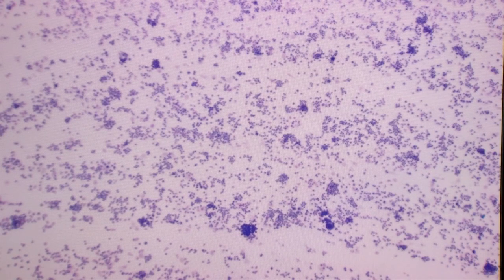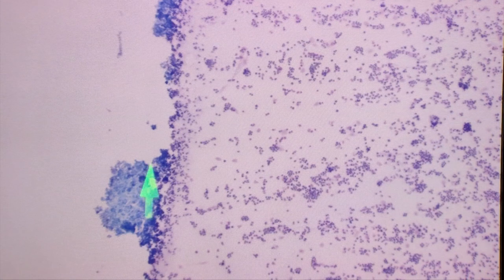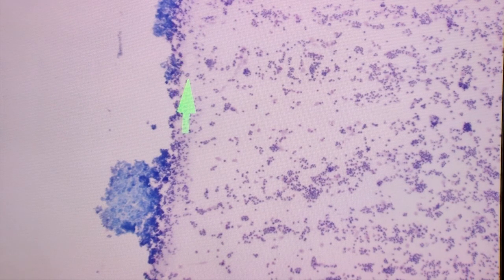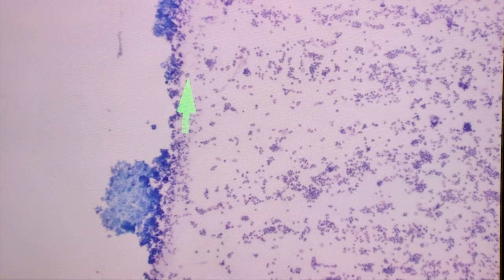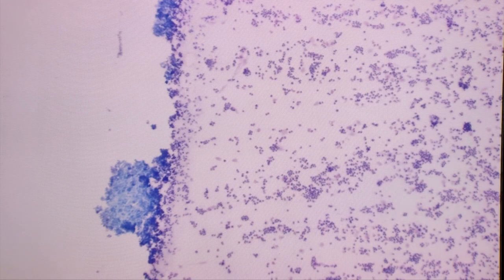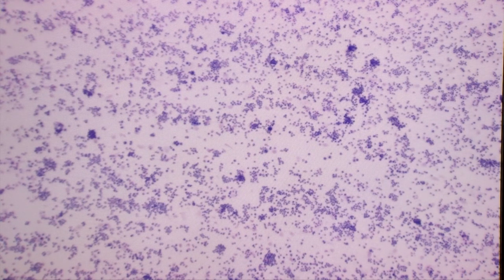The first place we like to start is just to look at the edge of the smear. Here you can see we're at the very edge — this is as far as the staining process went, as this smear was stained in an automatic stainer with Wright-Giemsa. We want to look at that edge to see if there are any large clumps of cells that could be a neoplastic cell population, or if there are large organisms at the edge of the smear. We would always look along that entire edge, then move into the smear.